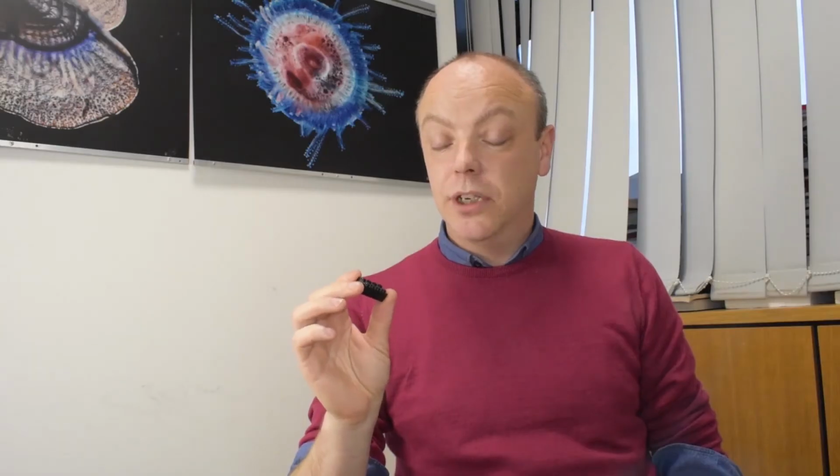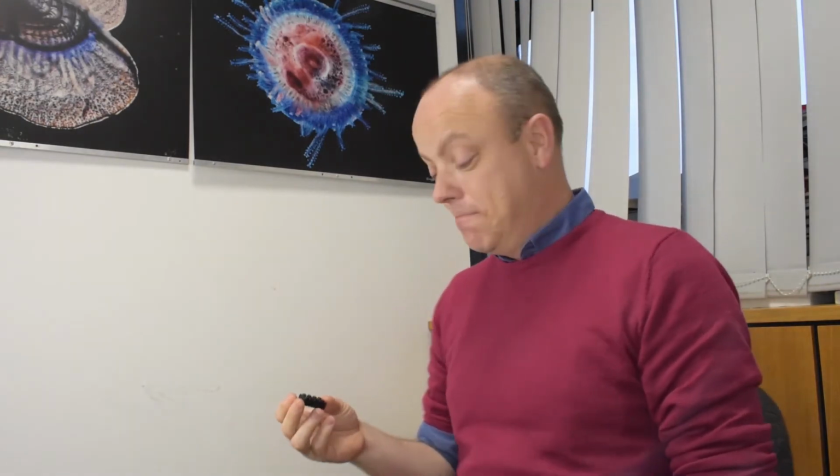So if you have a sample about 1 centimetre away from the lens, that's going to give you pretty good field of view and should be pretty easy to focus in on something like that. So you don't have to use Lego, but it's an easy way to get a nice stable base. Lego is not a toy. This is serious engineering. Who am I kidding? It's a toy and I'm a grown man who plays with toys. What can I say?